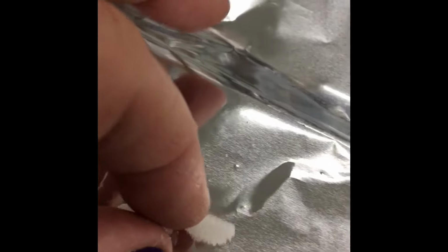And the next one we have is citric acid. It almost looks like table salt. Again, white, solid, crystalline. And then we have wax. Okay, this has a little bit different texture. It is white, it is solid, but it feels not crystalline. So no crystalline structure on that, not crystalline.